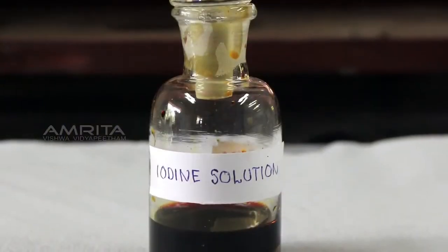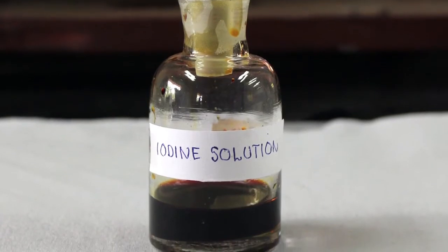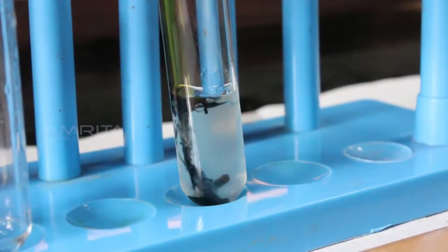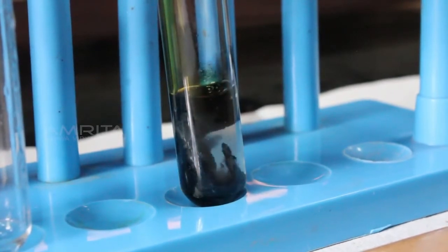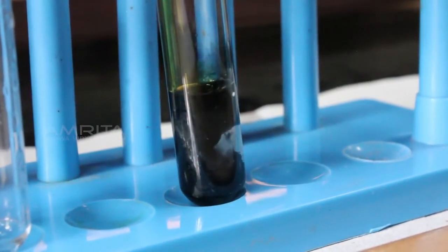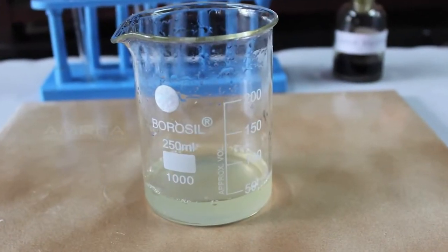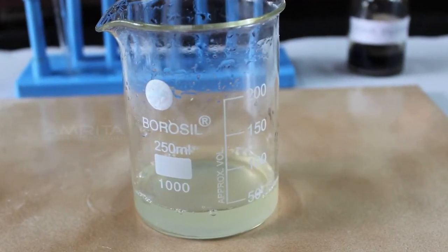We can use iodine solution to test for the presence of starch. When adding a few drops of iodine to a test sample, if the solution turns blue-black, it indicates the presence of starch in the solution. Our aim here is to test the presence of starch in a given food sample.